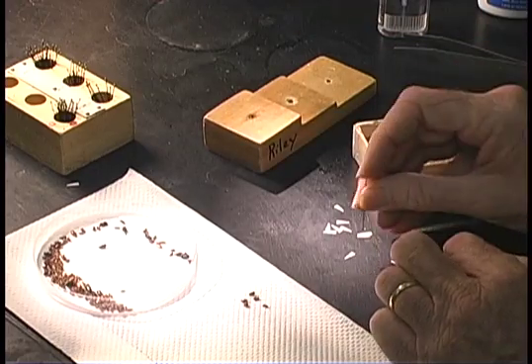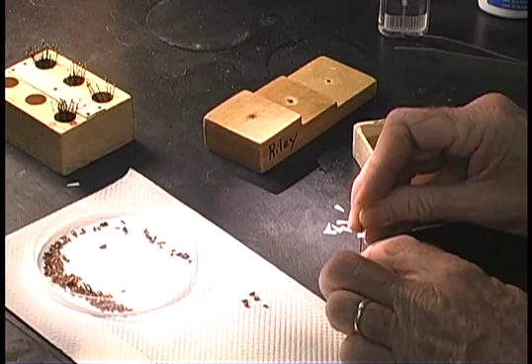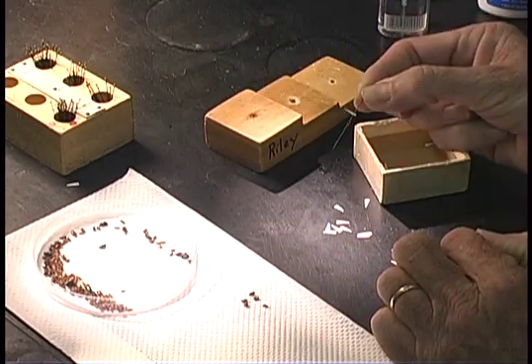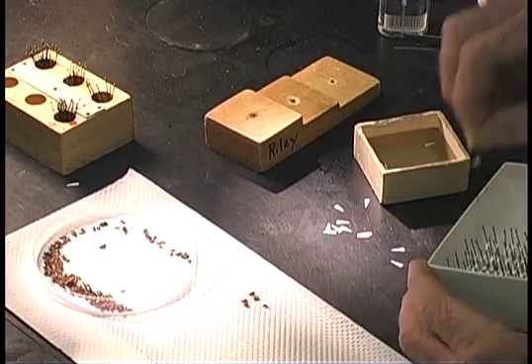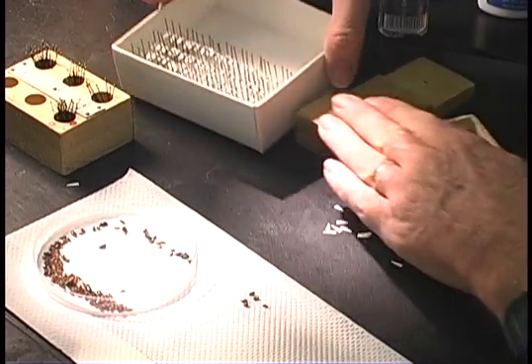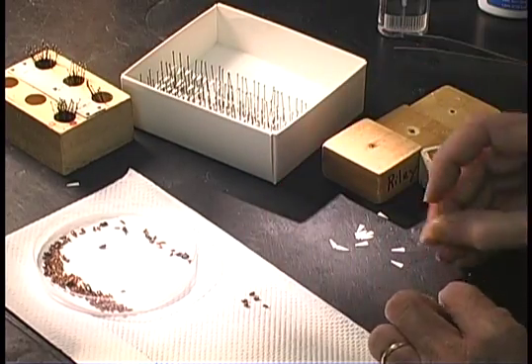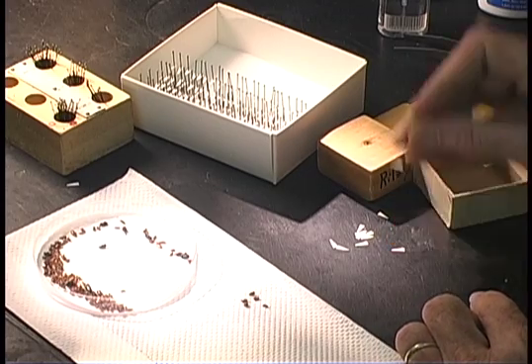Once you have your points, they need to go on the pins at a uniform height. They should be pinned in the center of the base. What we do is we literally line up hundreds of these at a time and pin in the center of the base.